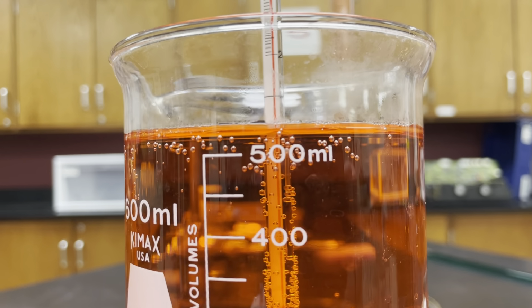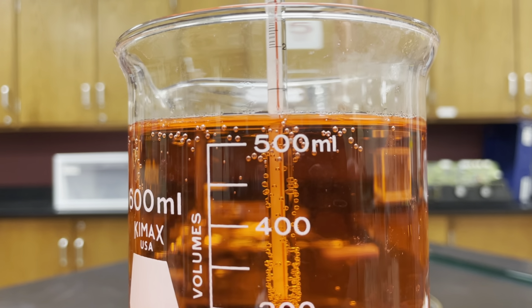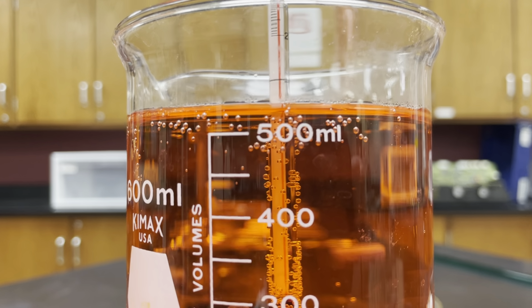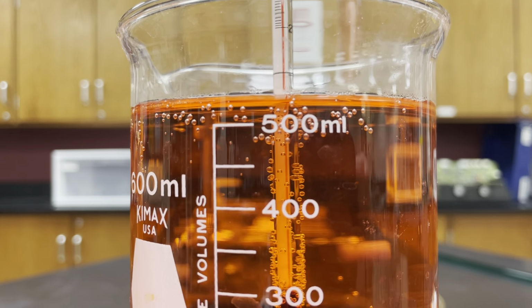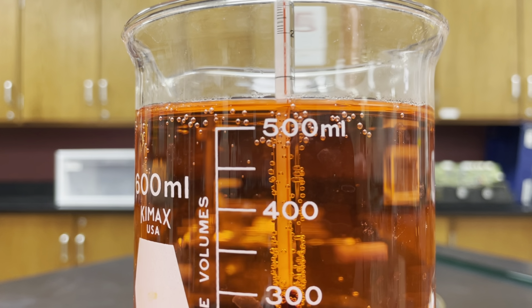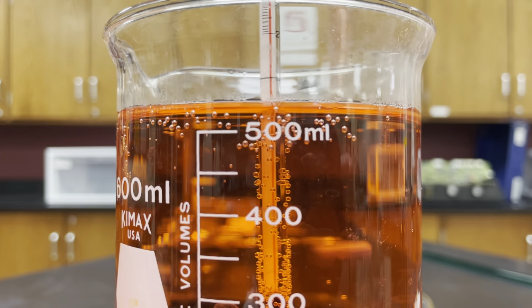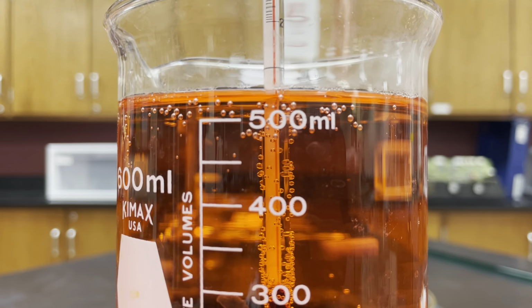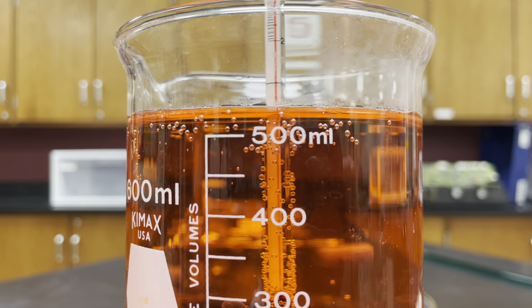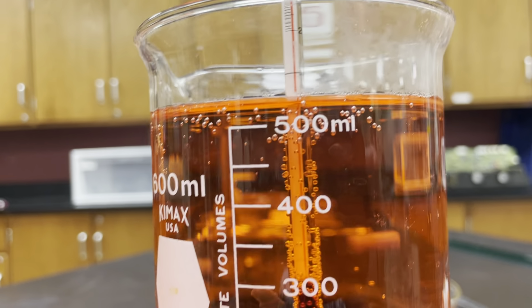I understand, but it's best just to remeasure the liquid in something that fits the appropriate amount you have, okay, rather than trying to eyeball it from here. If your measurement is past the point of what we actually have marked on your glassware, it's not really safe to say we know how far past that we are. And that goes for things like glassware that's made to dispense stuff.